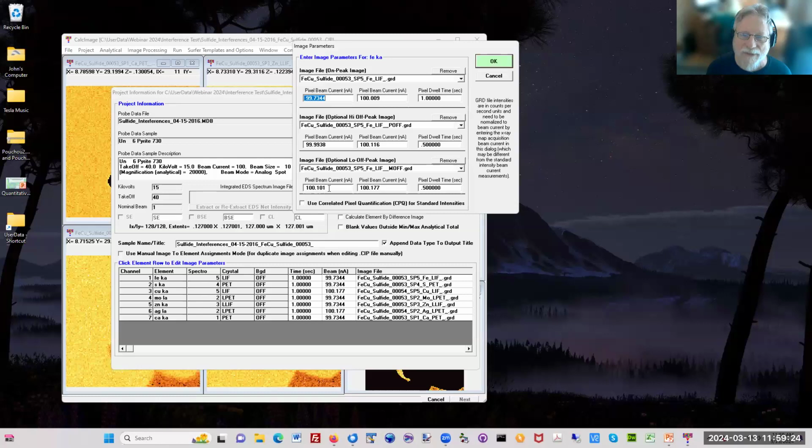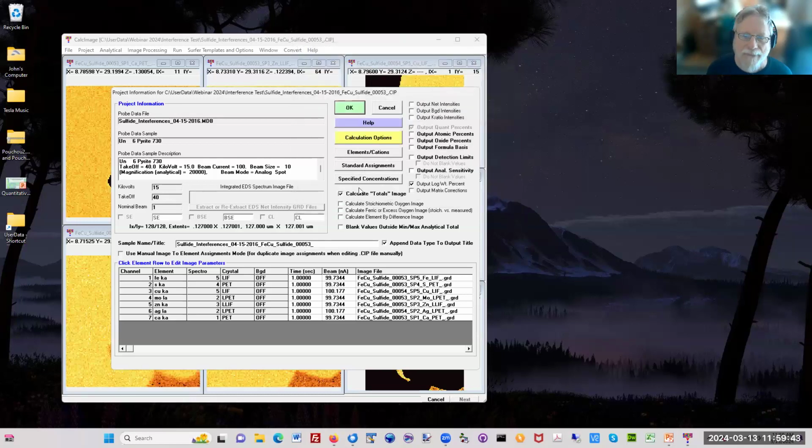So here's the beam current measured at the beginning of the map, and here's the beam current measured at the end of the map, and here's the dwell time for the backgrounds, half a second each, and for the on peak was 1 second. So that's how we can do a drift correction. So you measure the beam current before and after the map. So that's how you get it, 100 nanoamps here, and then 1 second. So 1,000 milliseconds. That's a pretty long map.